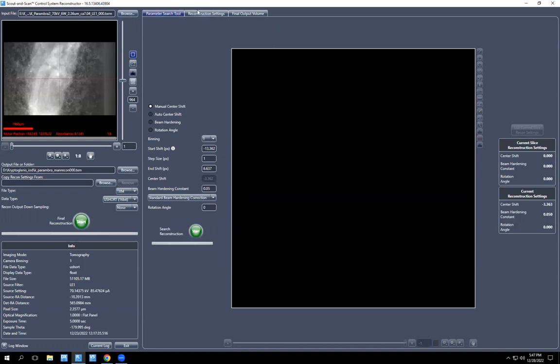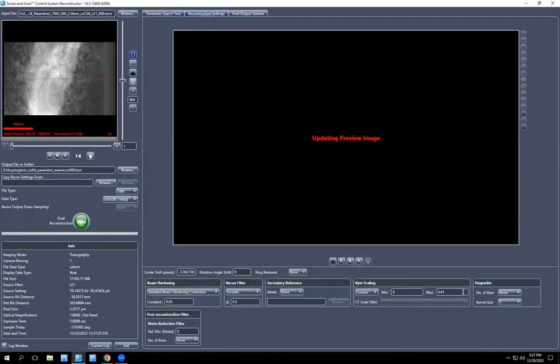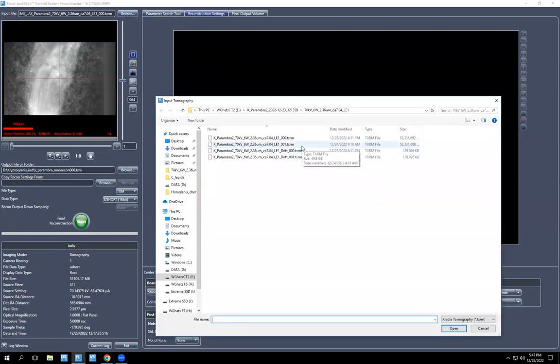When you already have something reconstructed, you can open the raw data and it will automatically have the same settings that you used. So you have your reconstruction settings over here, and on this tab, you will have your byte scaling settings that you used as well. I chose 0 and 0.41 for the first segment of the scan, and then we are going to use the same for the next segment. So I'm going to open the second segment of the scan.